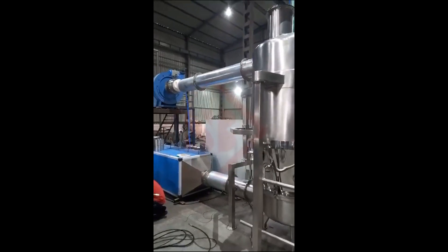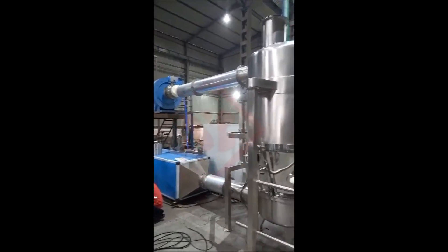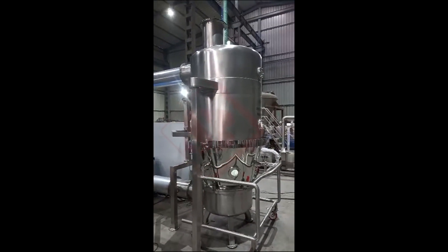Fluid bed dryers are commonly used in various industries, including pharmaceuticals, chemicals, food processing, and minerals.